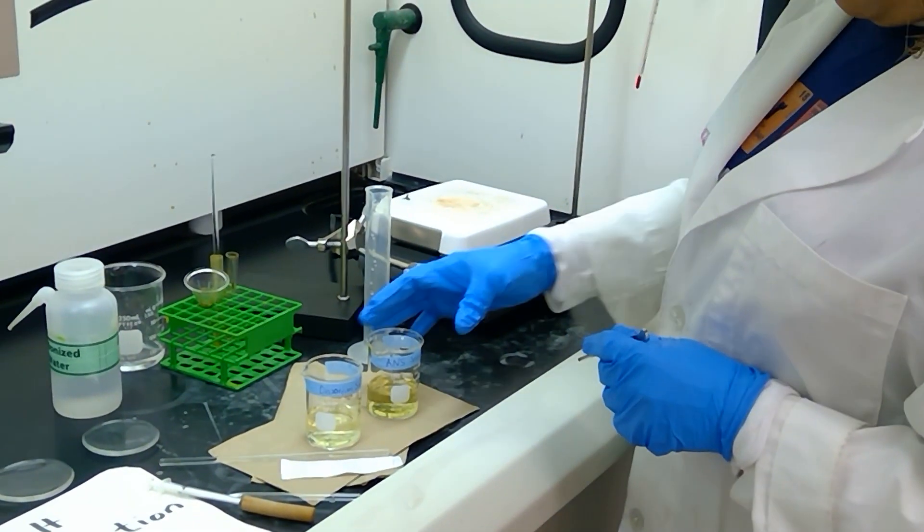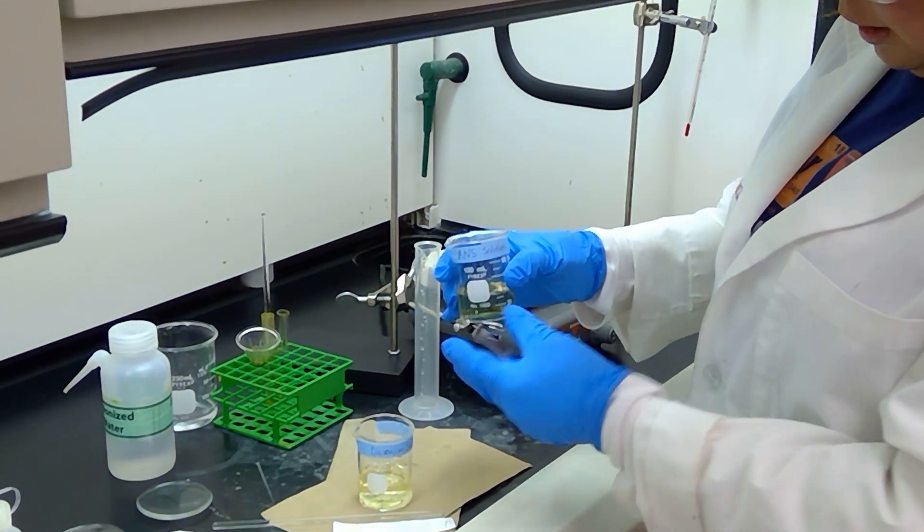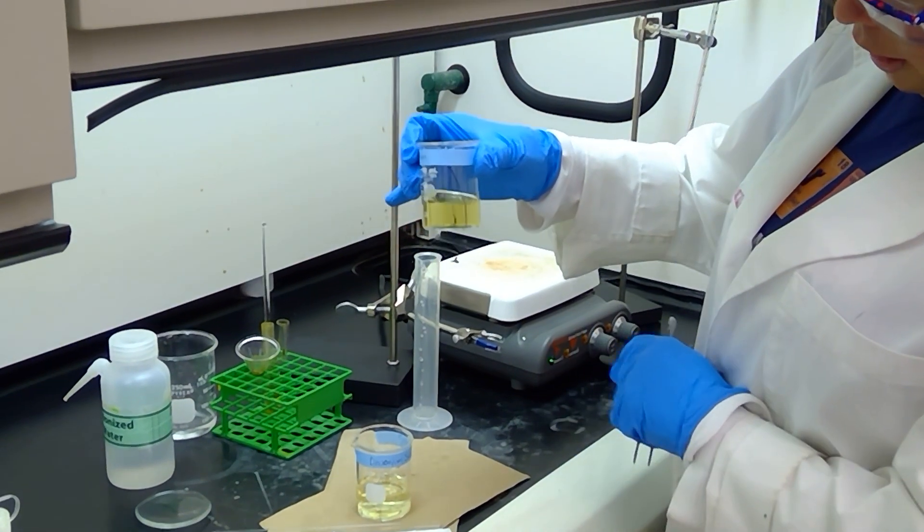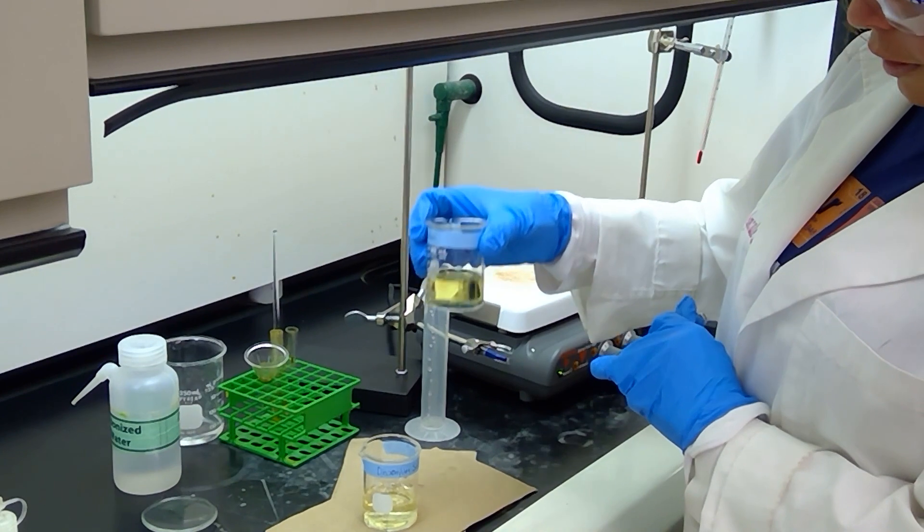All right students, so I have dissolved my 100 milligrams of ANS into 35 milliliters of water, and we have a pretty clear but yellow solution. I mixed it around just to ensure that all of my solid has dissolved.